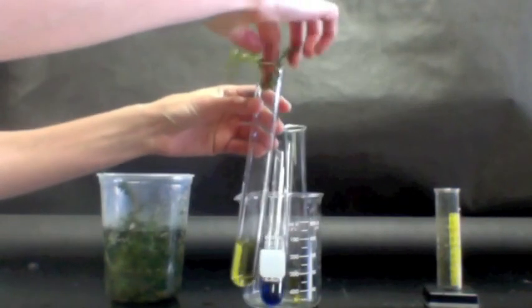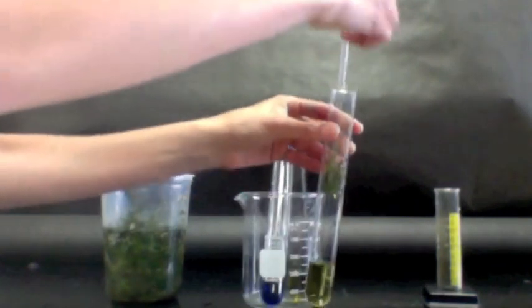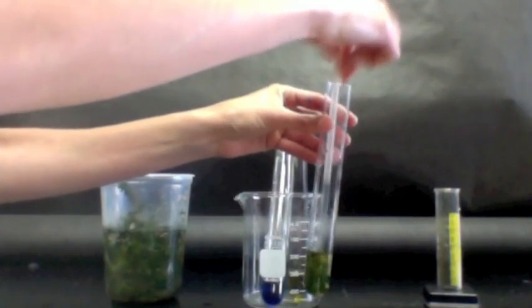So we're going to put a plant in one of these, and we will just push it down with this straw. And we're going to make sure the plant is submerged.